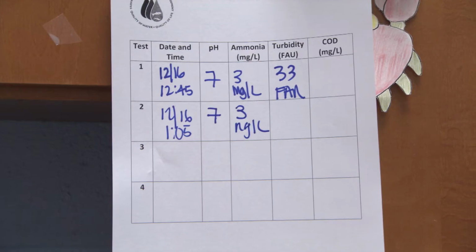Just when you think day one couldn't be any busier, there are still things to do, such as beginning the secondary treatment process, cleaning up from day one, and of course, set up for day two. Let's start with secondary treatment.